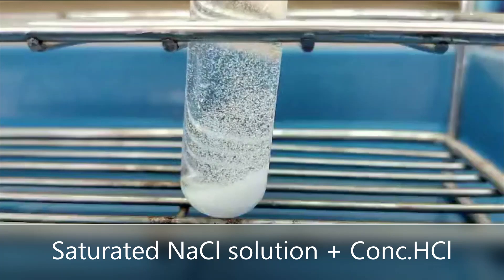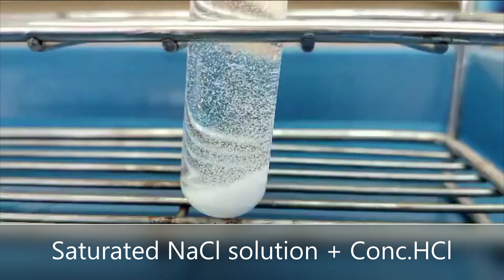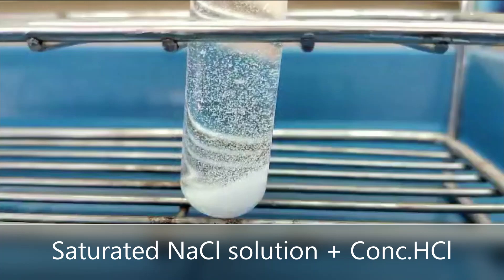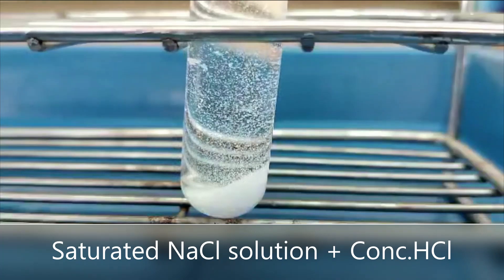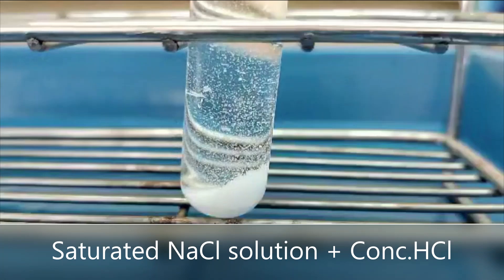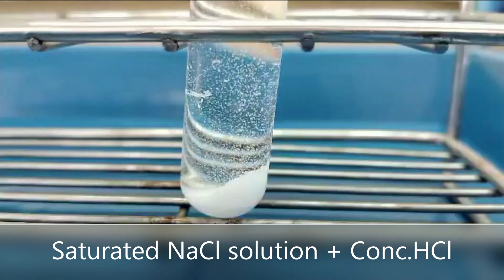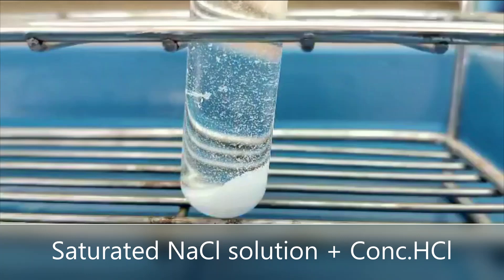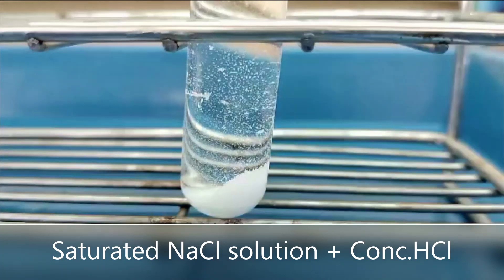From the experimental results, according to Le Chatelier's principle, a saturated sodium chloride solution will normally have a concentration of 5.4 molars. That is, the chloride ion will have a concentration of 5.4 molar and the sodium ion will have a concentration of 5.4 molar.